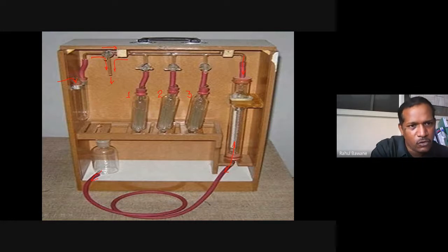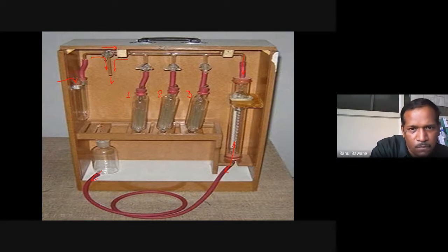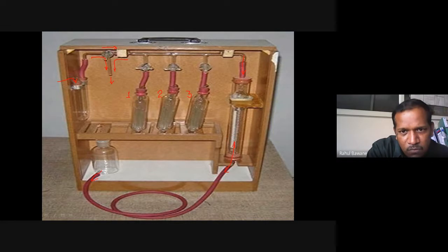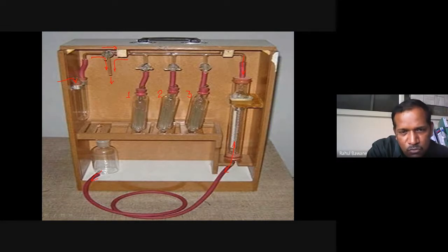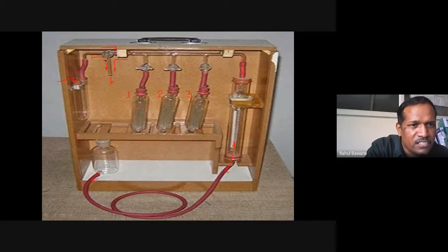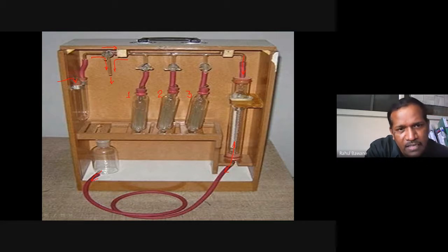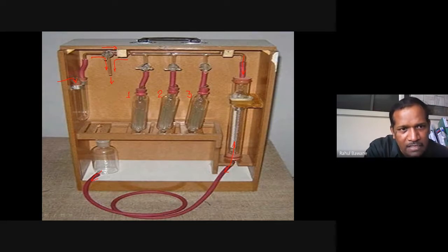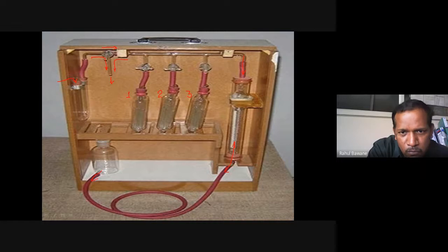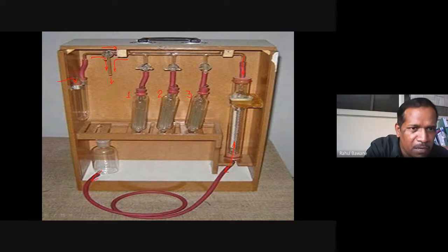With the three-way cock closed and the entire right-hand side filled with water, we lower the leveling bottle. As we lower it, the water inside the tubing decreases, creating a vacuum. At the same time, we adjust the three-way cock so that exhaust gas can enter from the left-hand side. As the water bottle lowers, water in the right-hand branches moves back, creating empty space that gets filled by flue gas.